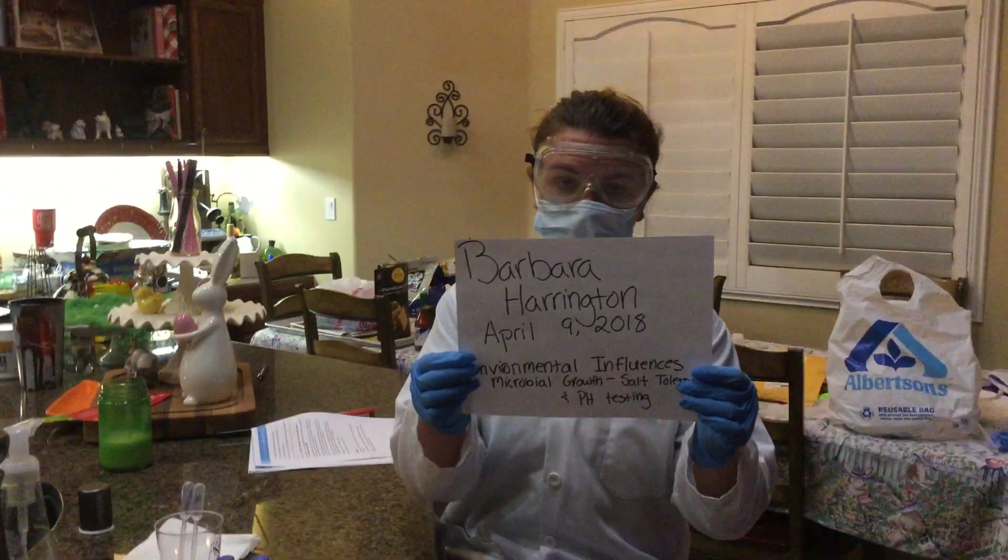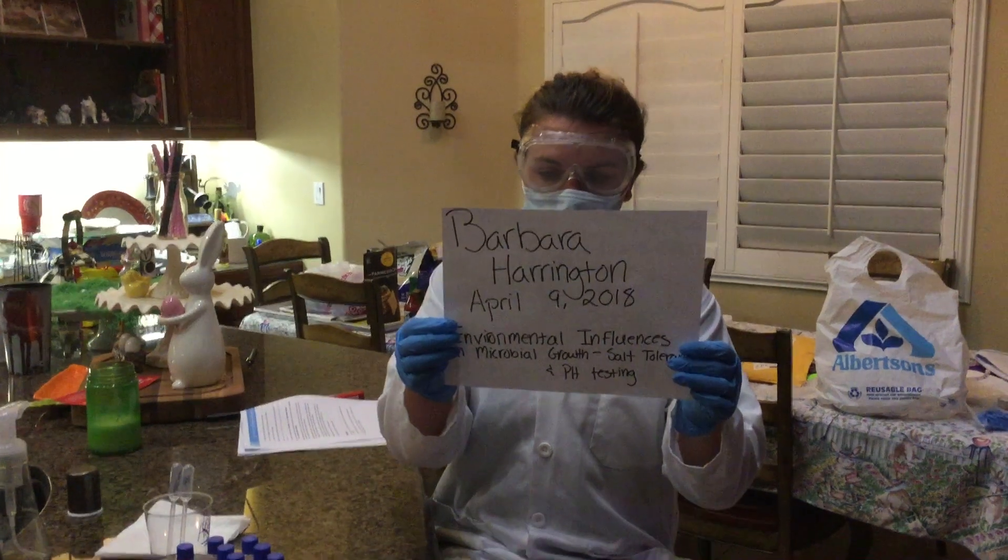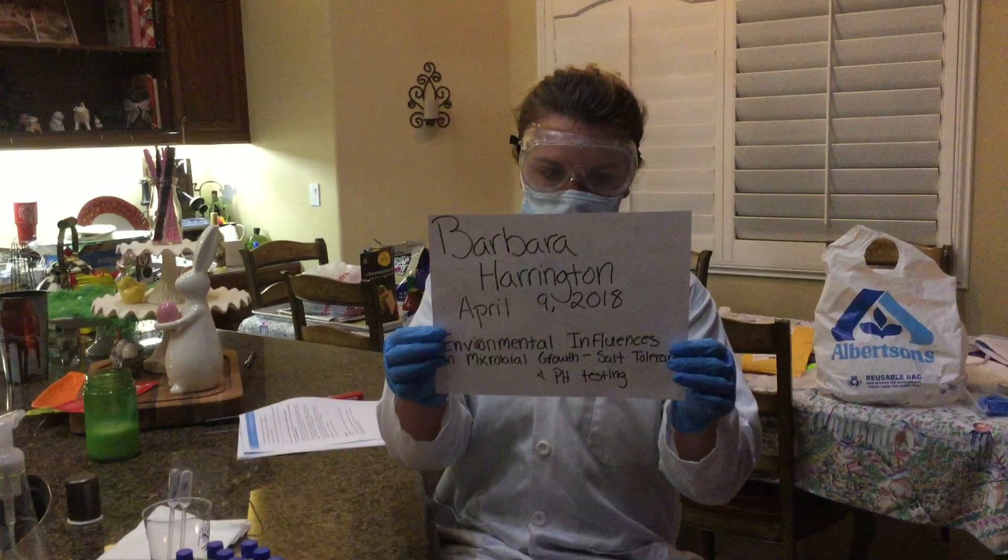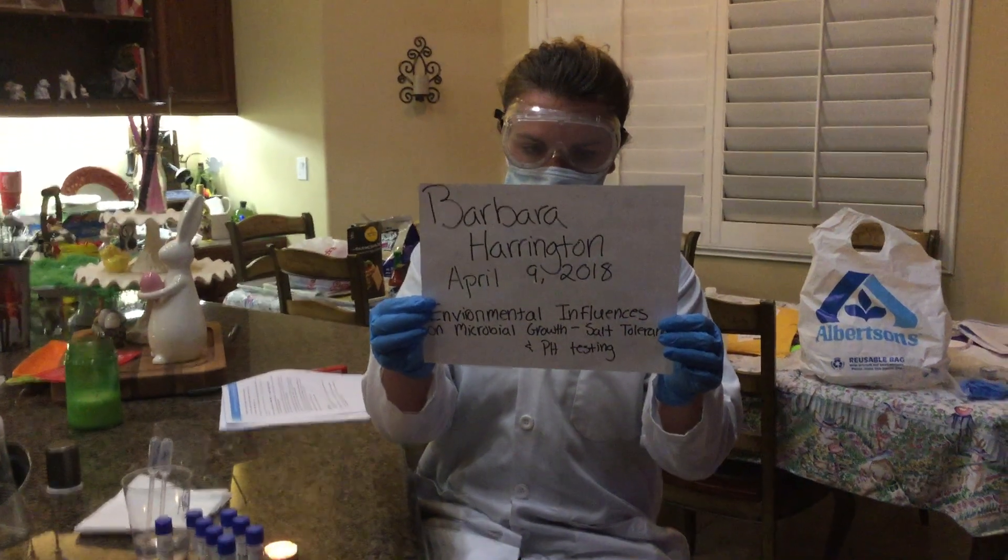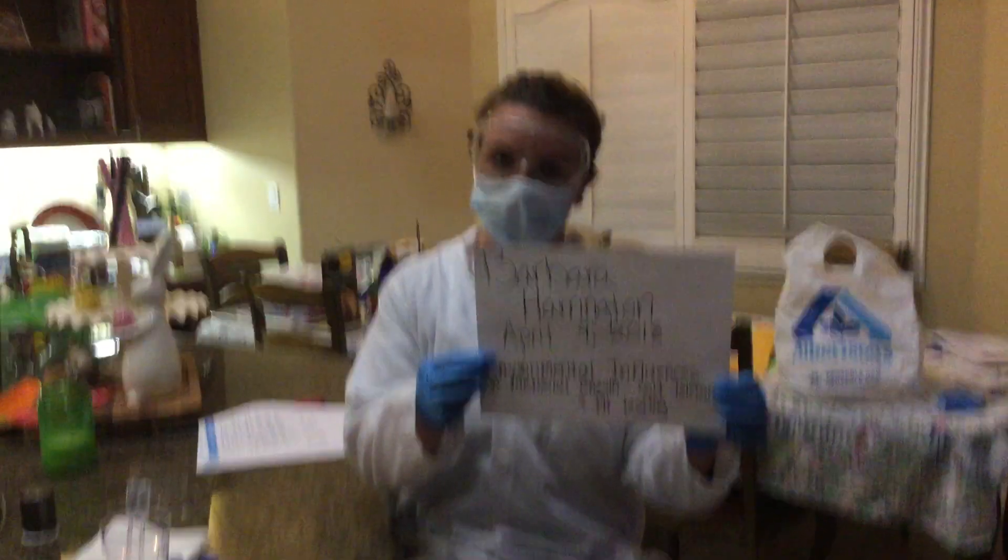Hello, my name is Barbara Harrington. Today's day is April 9th, 2018. We are doing the environmental influences on microbial growth, observing the salt tolerance and pH testing.